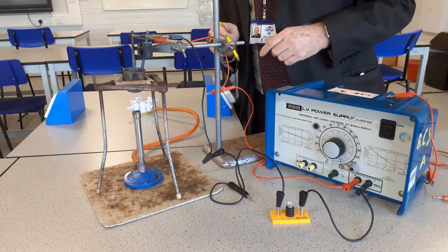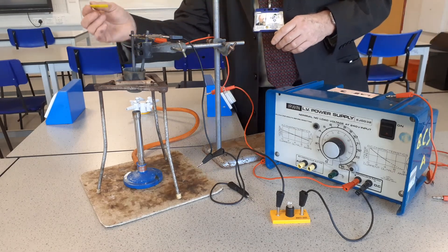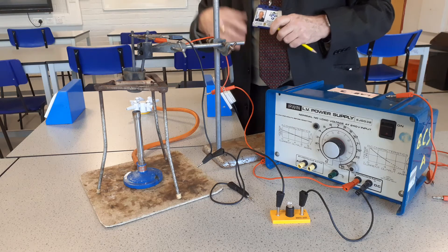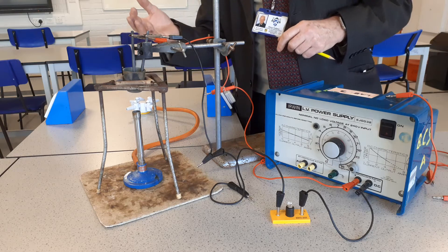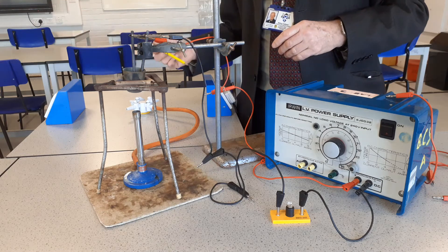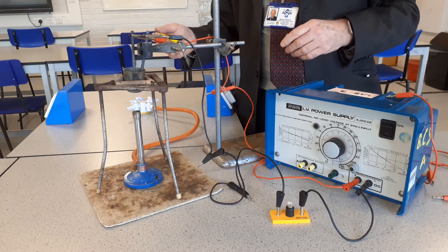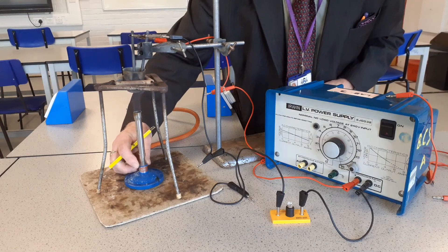The red leads come from the positive terminal and connect to another carbon electrode which is called the anode. The lead bromide is inside this metal crucible. I'm using a metal crucible because I need to reach a fairly high temperature. I'm using a pipe clay triangle rather than a gauze, which allows me to get a much greater temperature.